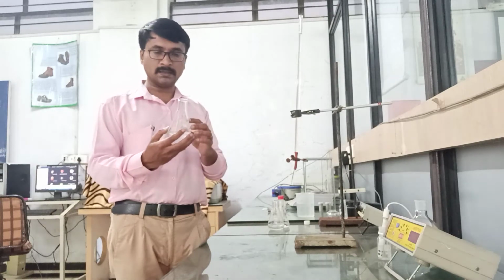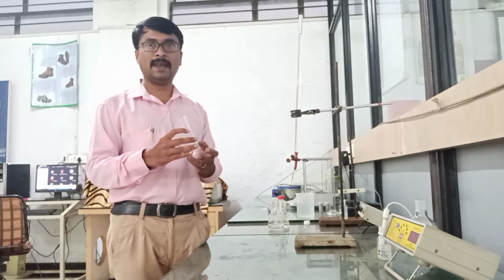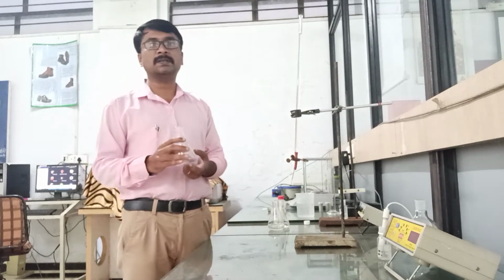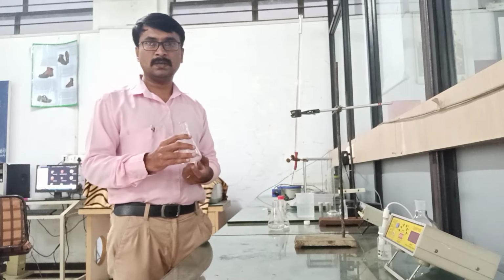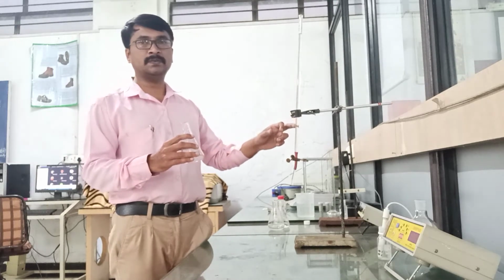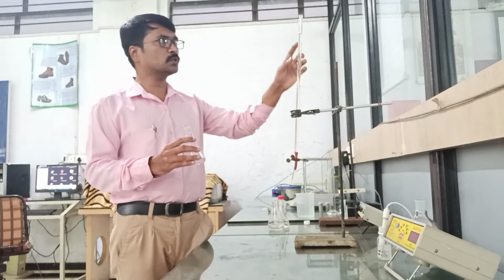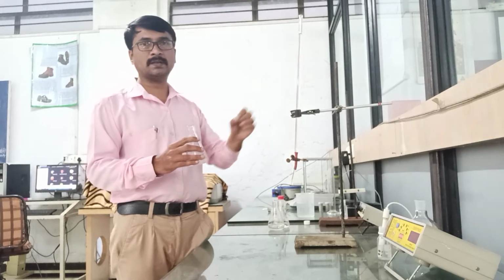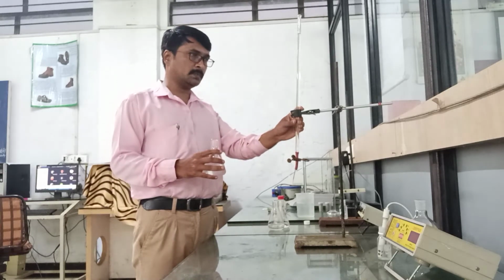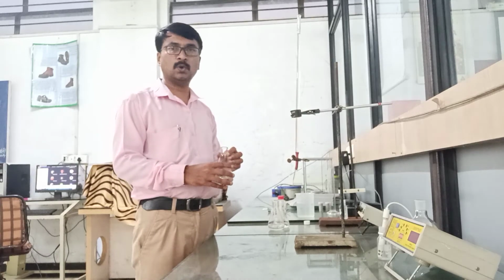So, we can titrate or determine this carbon dioxide content by using the volumetric analysis method, in which the acid content in a water sample in the form of carbon dioxide is neutralized with the help of a base. For this experiment, I have chosen sodium carbonate as a base for titration or neutralization. The concentration of sodium carbonate, Na2CO3, is 0.01 normal.